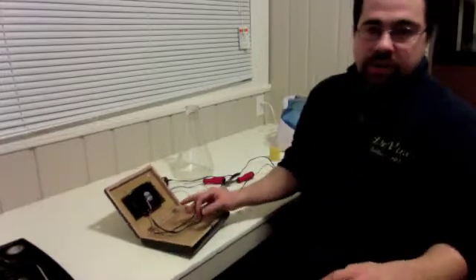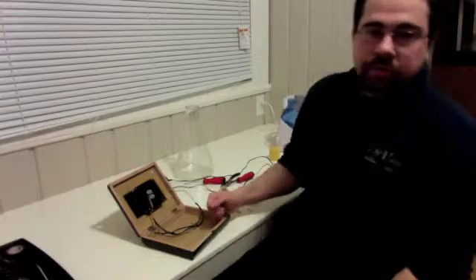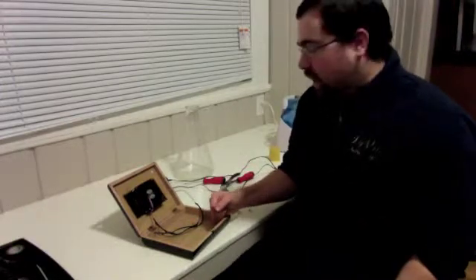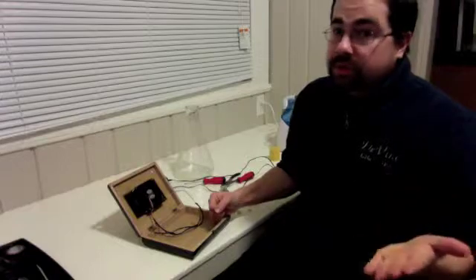You're going to have to plug it in and then match them up, which one goes to which. Otherwise it doesn't work, so you got to figure that one out. And that'll be the simplest one. You can do it with 4 parts: box, fan, charger, magnet, stir plate.